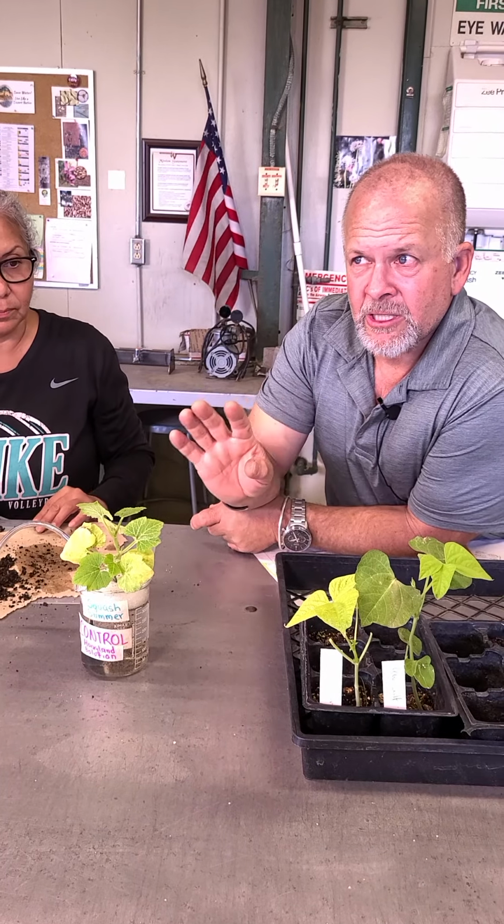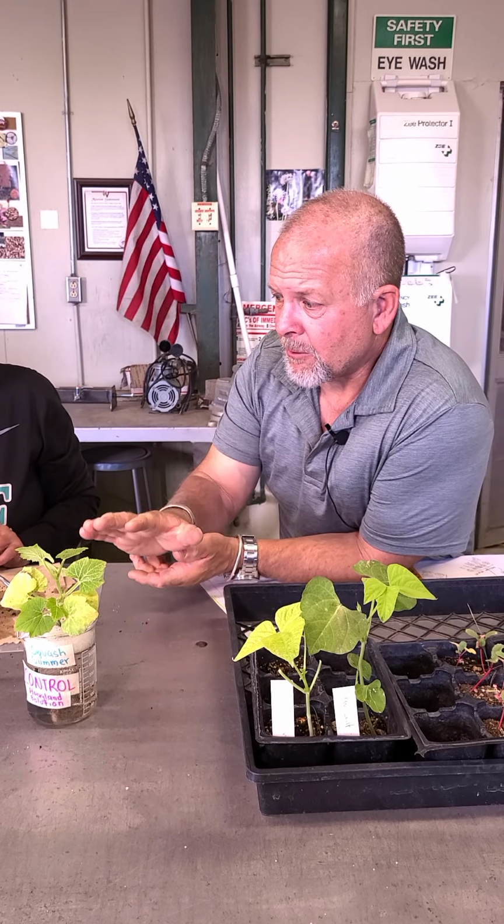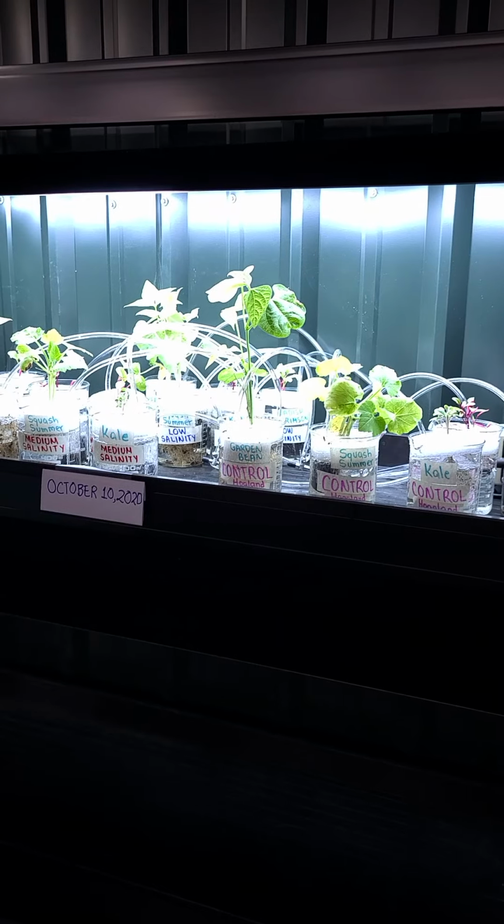This just is a measure of what happens when we give the plant everything it needs, but then we add salt, which could be detrimental to it. How will the plant behave, and what level of salinity is bad? And will the 5 different plant species that we're using, will there be a difference between those 5 species and the varying levels of salinity that we're doing? So that's what we're going to do. We'll put a quick pause through here. We'll get the other ones ready to go, and then we'll show you the final setup.